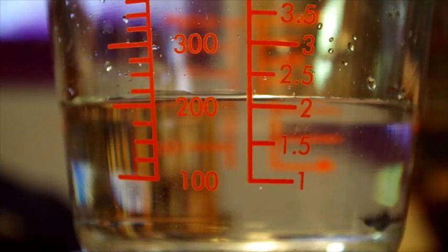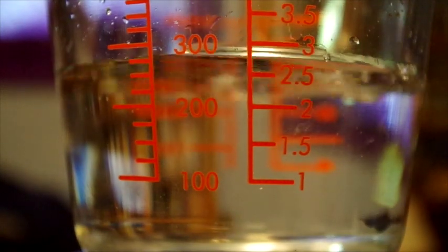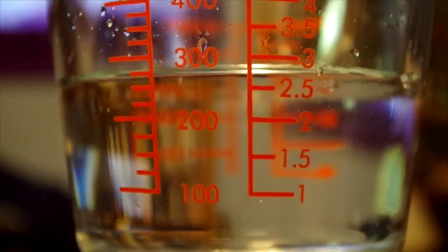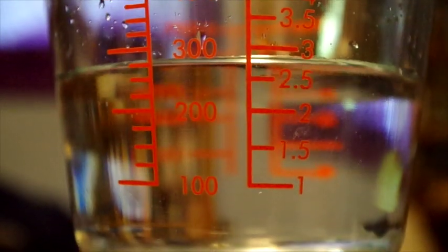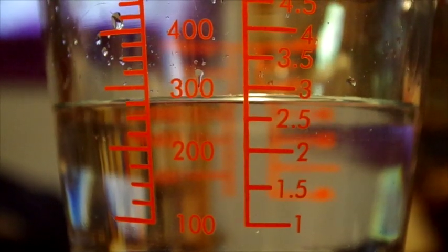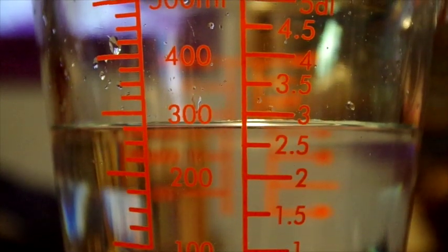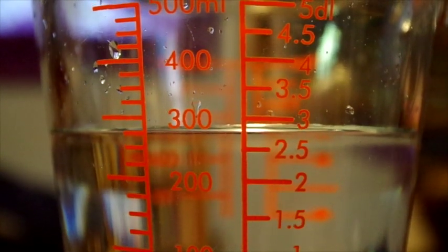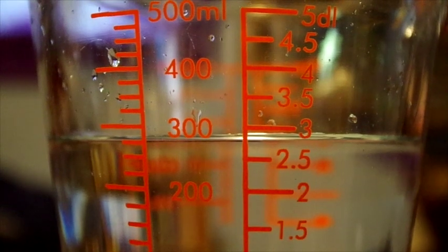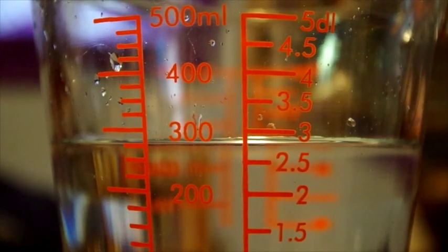So you can see there is only a demarcation every 25 milliliters on the glass. And the meniscus, once the camera is adjusted so that it's at the right level, you can clearly see is basically right on that line. You can imagine that the error of this measurement might be as much as 10%, but for the purposes of this simple experiment, it will have to do.